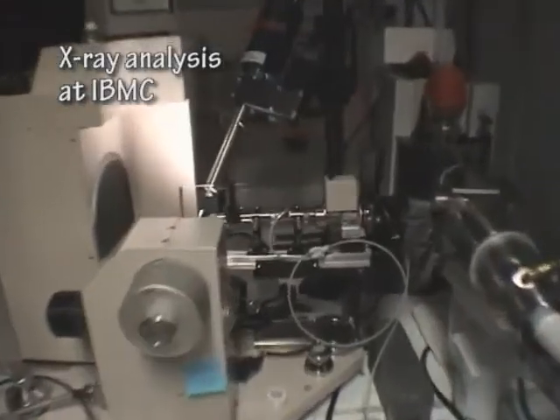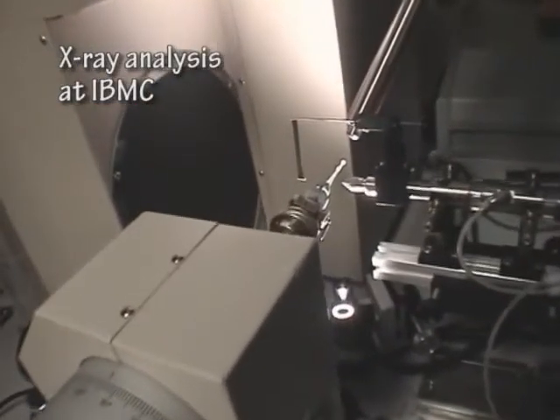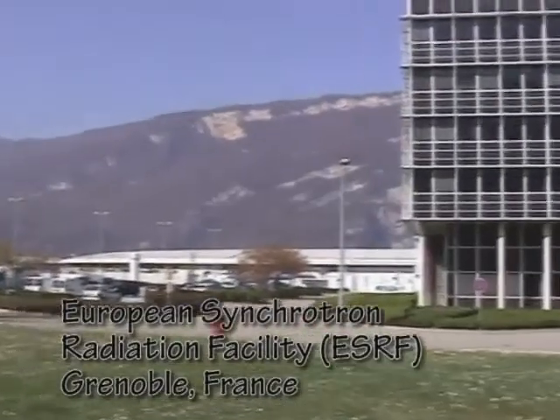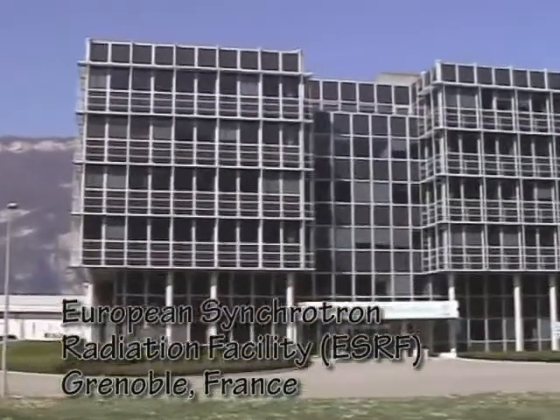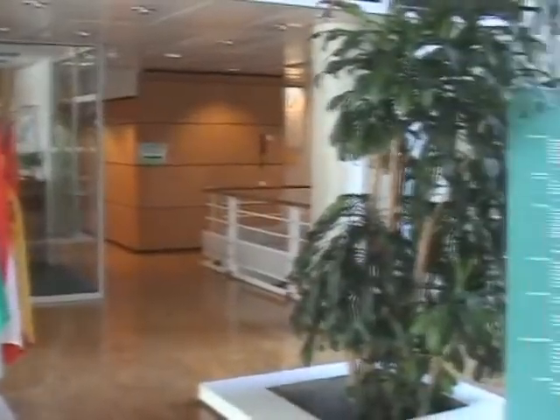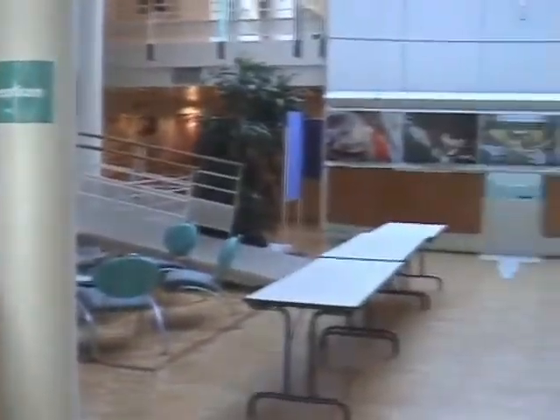Preliminary analysis of a crystal can be performed in the lab. The crystal is placed inside a thin tube of quartz, which in turn is placed inside a beam of X-rays. The diffracted signal is collected with the help of a detector. For a more precise analysis, a more intense beam of X-rays is used. This beam is produced by a particle accelerator called a synchrotron.